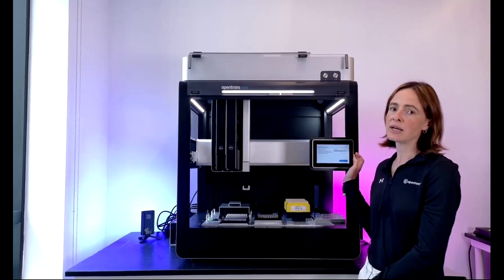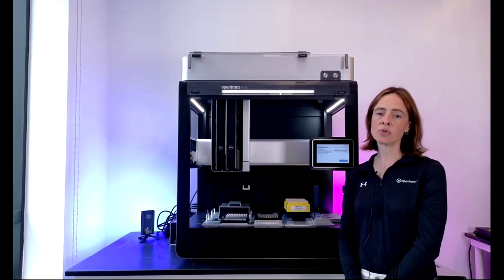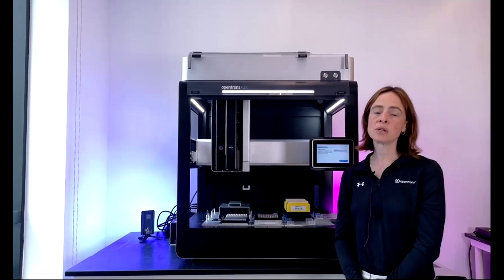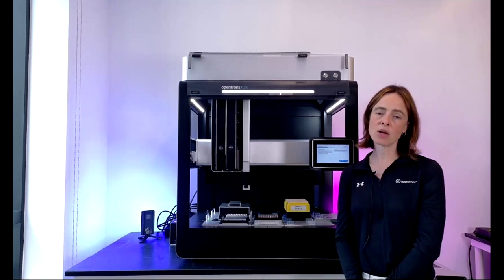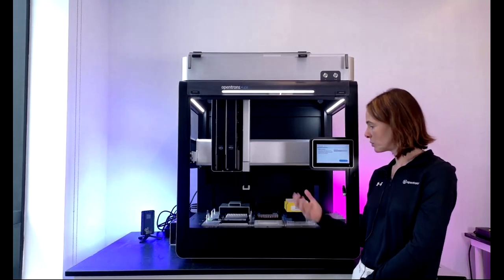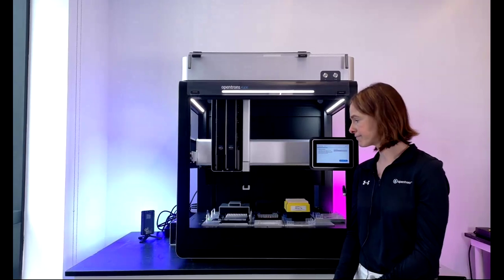One final thing that I just wanted to mention is this on-deck touchscreen, which allows you to easily store and pull up and then run protocols. It also guides you through deck setup, and Nick will talk you through that in a minute, and automated calibration. And most importantly, it's really here to provide you with a lot of prompts and guidance. So it really makes the steps that you go through before the robot starts to run really straightforward and easy to follow. And that should be for anyone in the lab to carry out experiments on this robot, whether they're really experienced with automation and Opentrons products or not experienced with automation at all.